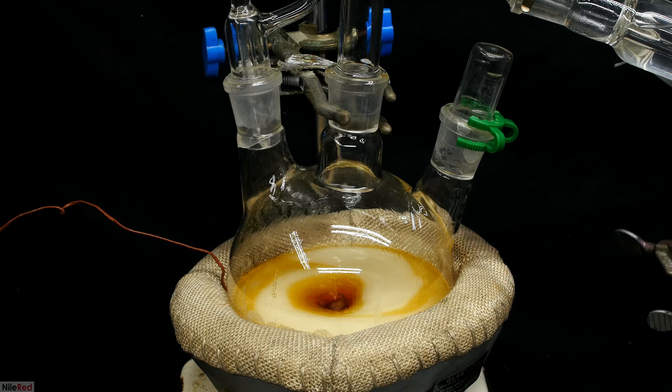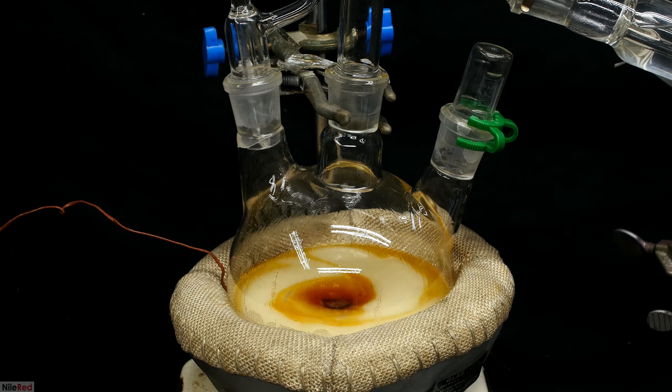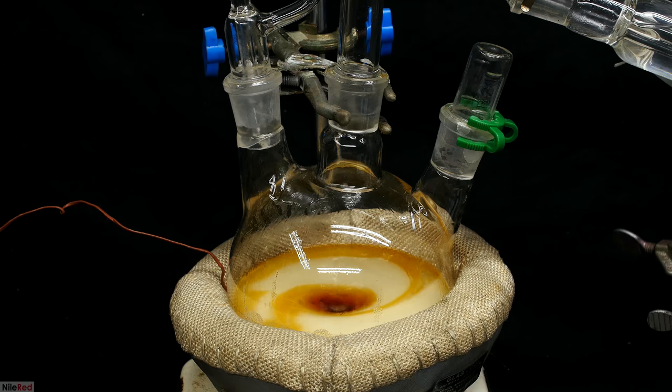Trimethylamine gas is miscible with water, but it can be separated by boiling it out. It's pretty common for trimethylamine solutions to be around 45% by weight, but that's in pure water. The solution here is saturated with sodium chloride, so the amount of trimethylamine that's dissolved is definitely much lower.